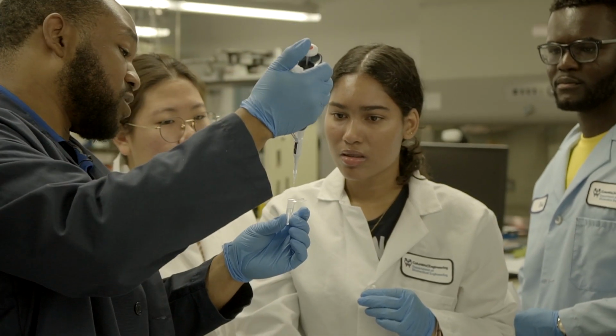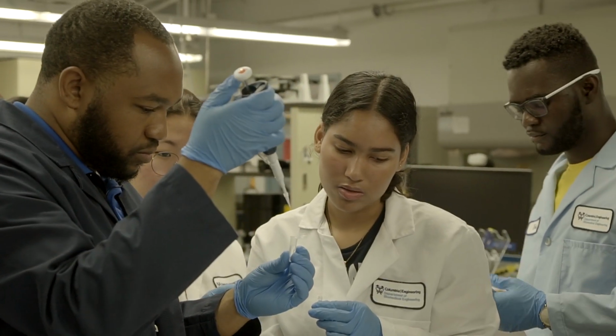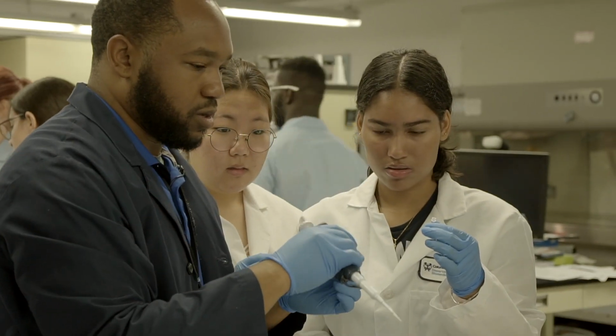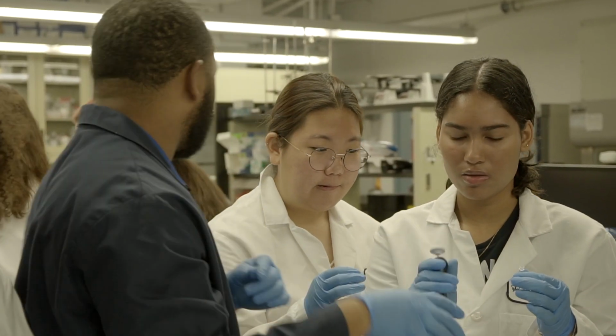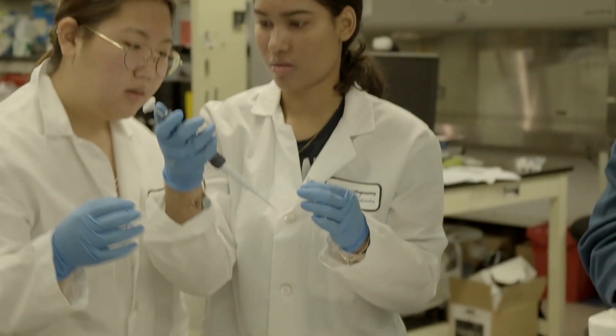So if you didn't see it, it's possible you didn't add it. So which reagent was it? Okay. So it's a smaller volume, so it's not working. If you didn't see it, it's possible it's not there, so you can do that one again. It's not going to go wrong.